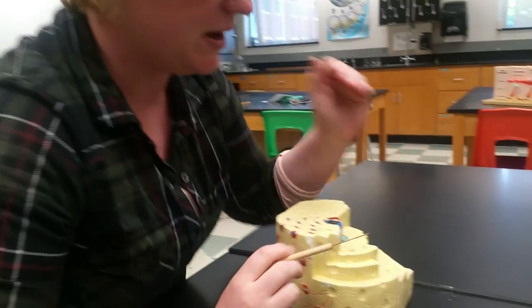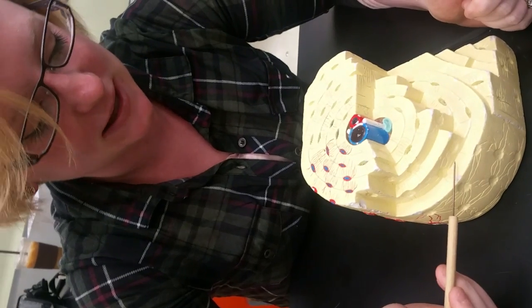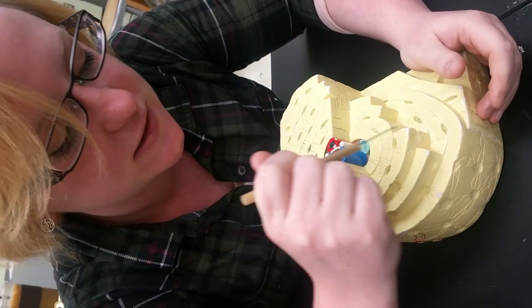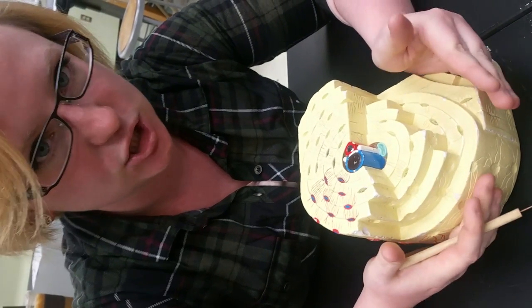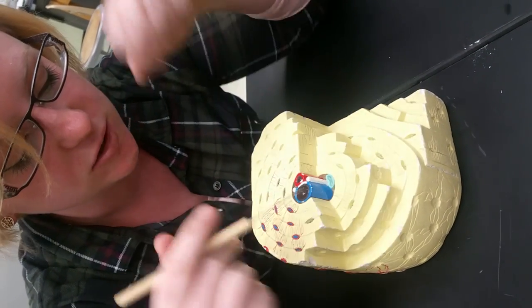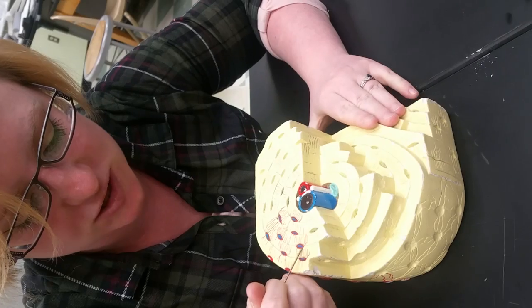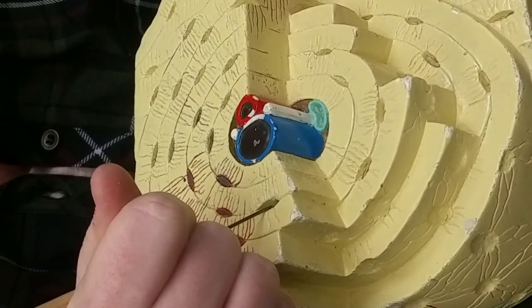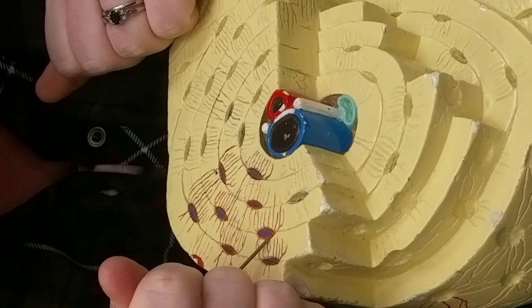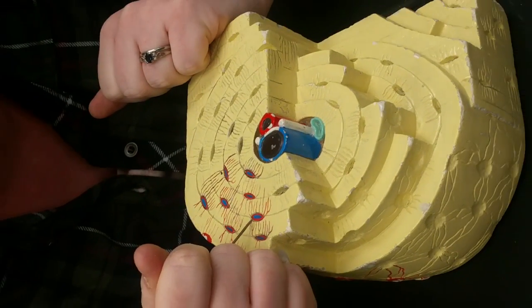The thing making up the osteon, these little rings, these tree trunk rings, these are referred to as lamellae, L-A-M-E-L-L-A-E, lamellae. And these are just rings of a calcium compound, and they are what makes up the solid tissue of bone, okay? Within these rings, you'll notice that over here we have these crazy looking eyeball guys that are red and blue, and then we have these little pock marks that they kind of live in, okay? So these guys here, they're red and blue, are the actual bone cells.